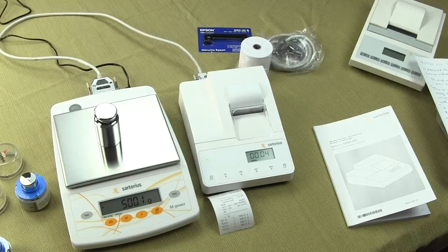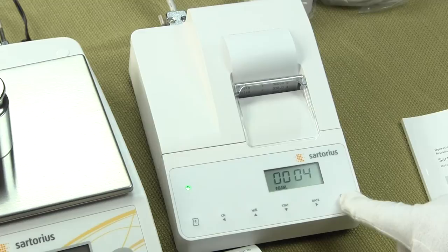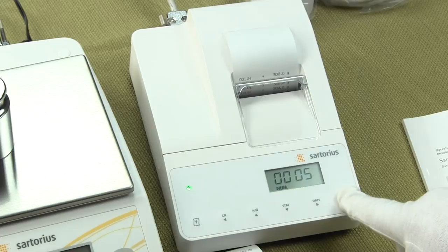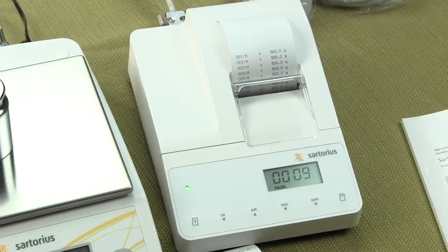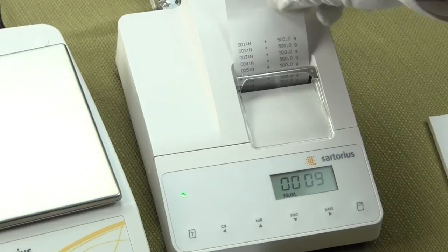On the printer itself, you can notice on the LCD that each time I send over the data, that LCD is incremented. So right now it's incremented to four. The printer itself does have a print button, so I can get the data from the scale and send it to the printer by simply pressing the print key in the lower right-hand corner. Each time, the printer numbers each weight reading. You can see the first reading, number one, was 500 grams; the next reading, number two, was 500 grams.